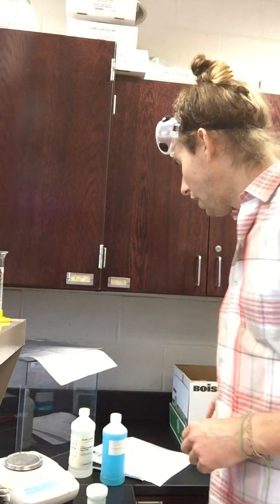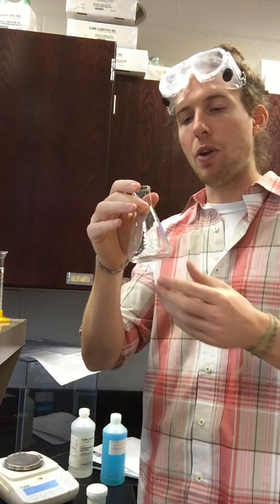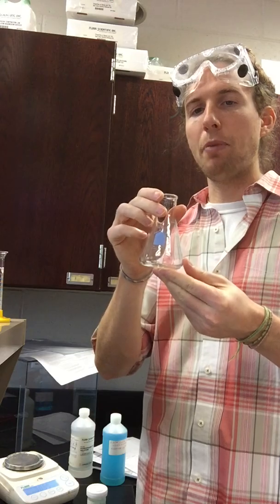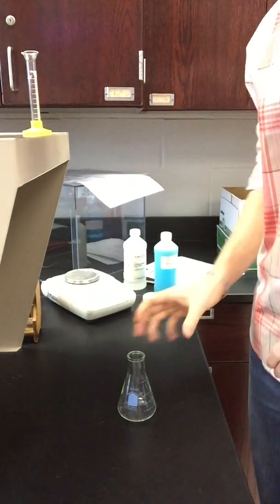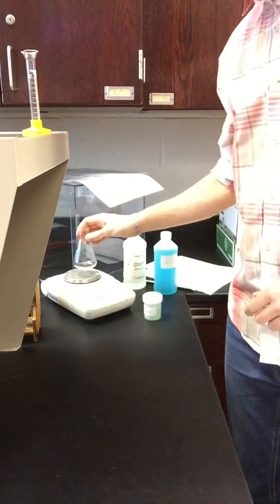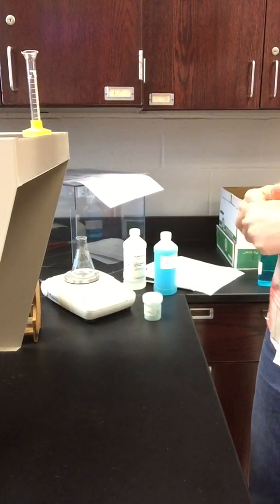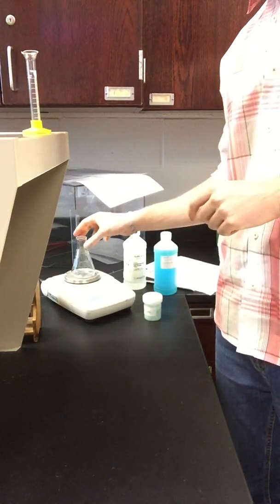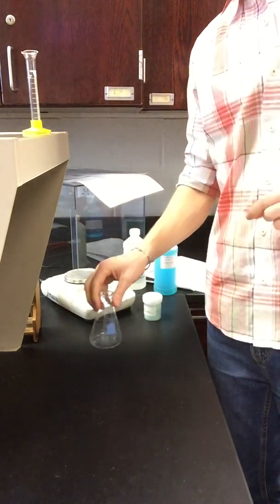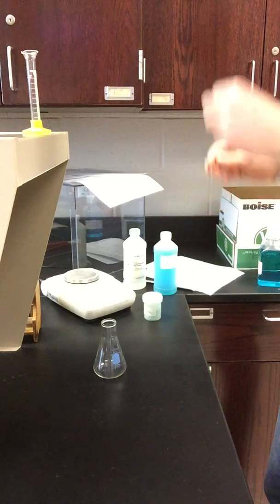So looking at part 1, we are first asked to find a clean Erlenmeyer flask. So I'm going to aim the video down for us. We've got a clean 125 milliliter Erlenmeyer flask, and we're going to find the mass of that flask. So you can see that I've got a balance, I've got a fume hood for our reaction. I know you can't see it, but I'm going to throw this Erlenmeyer flask on the balance that has been tared. And I will tell you that the mass of that flask is 68.593 grams. So you guys can go ahead and record that.